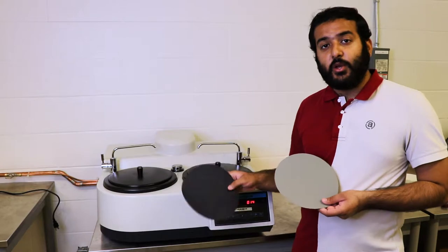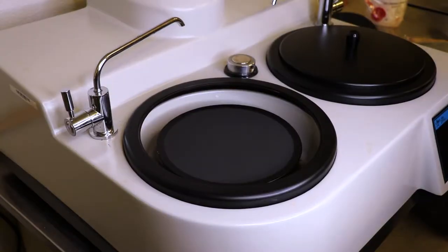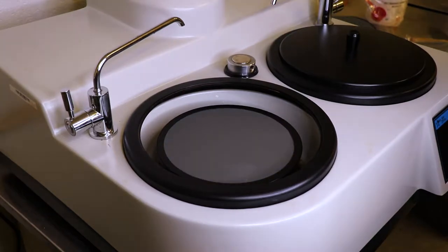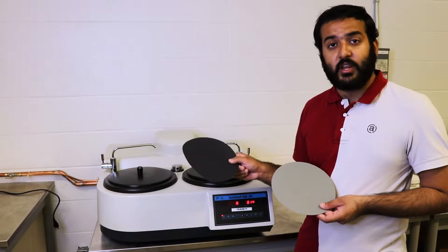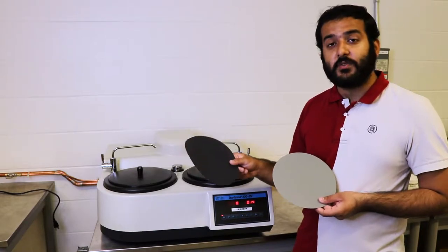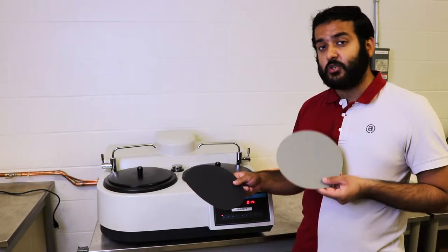Now you have various types of grit, starting from 180 all the way up to 1200. You want to start by cutting your sample with a very rough grit paper. Anything with a lower number generally cuts rougher, and anything with a higher number usually cuts finer. So you want to start with the lower numbers and work your way out.